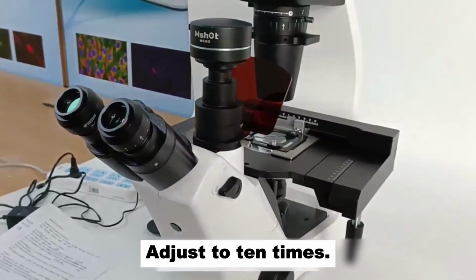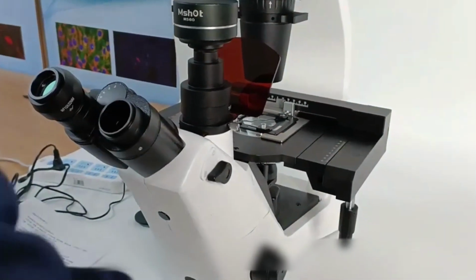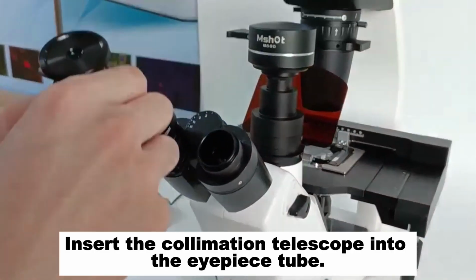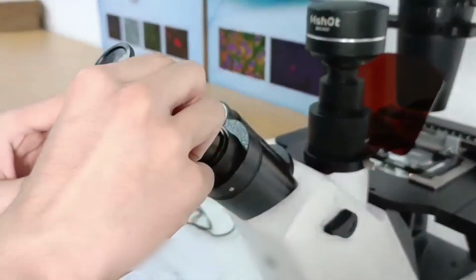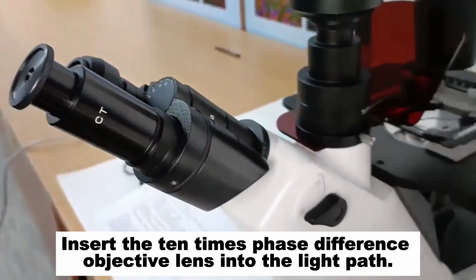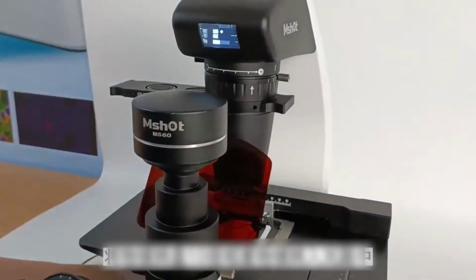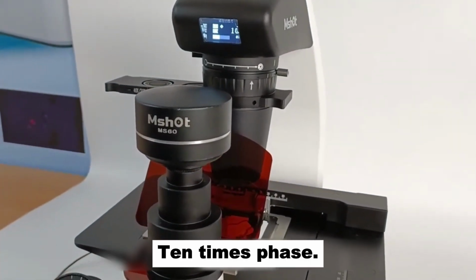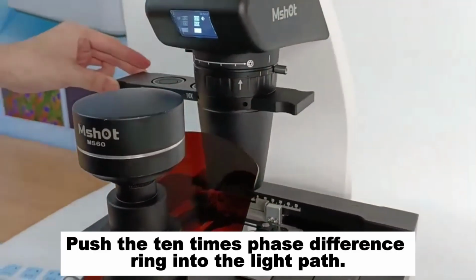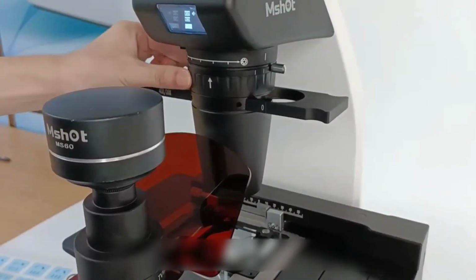Adjust to 10 times. Remove one eyepiece. Insert the collimation telescope into the eyepiece tube. Insert the 10 times phase difference objective lens into the light path. Push the 10 times phase difference ring into the light path. Adjust the aperture.